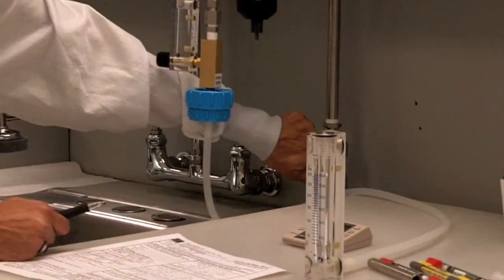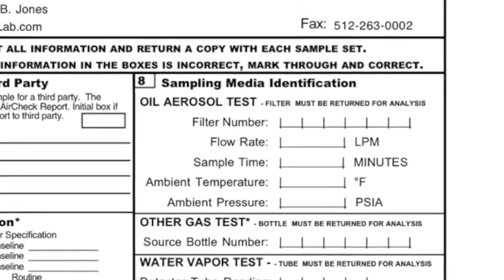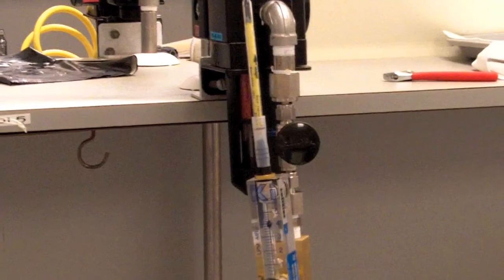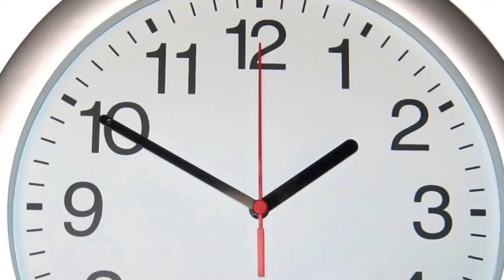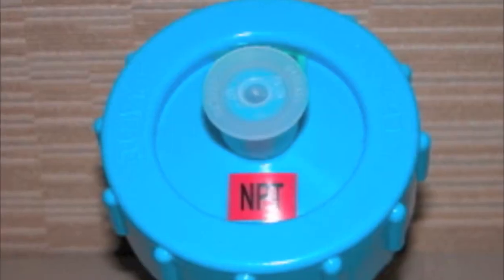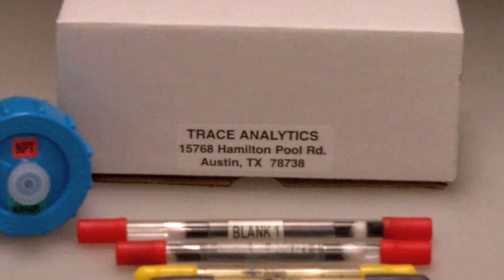You can now close the system valve. Note the full length of time for the oil aerosol and particles test. In some cases it will simply be the time you set for the timer. In cases where the other two tests ran for longer times, add the additional time. This is when it's very helpful to know the actual clock time of when you began the first test. Replace the caps onto the filter cassette and place into the pre-addressed return mailer.